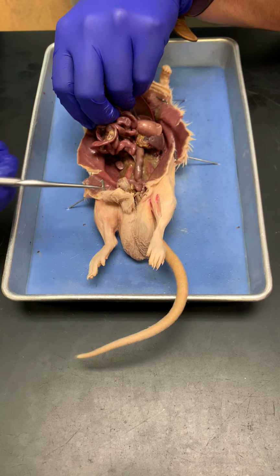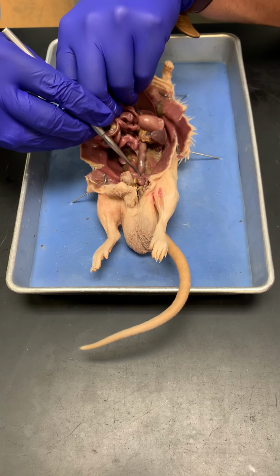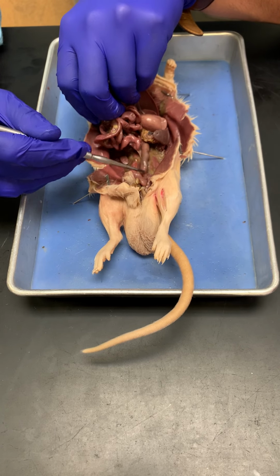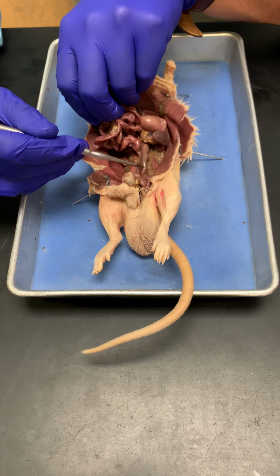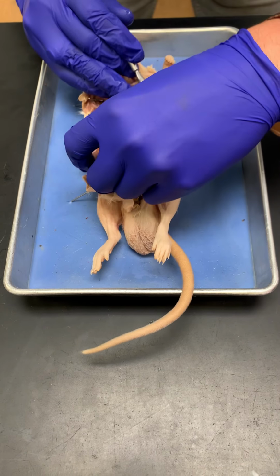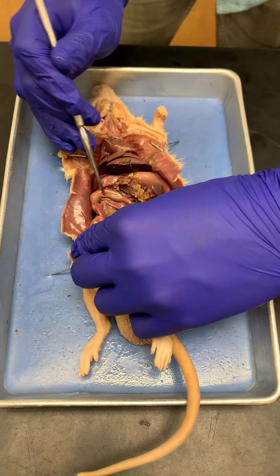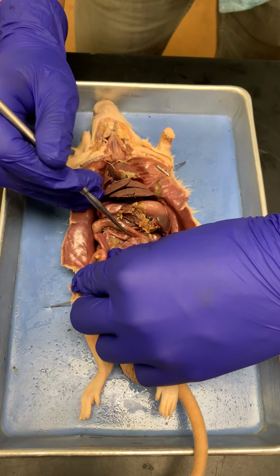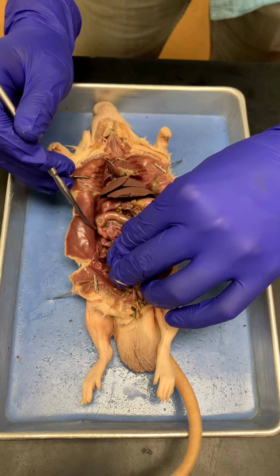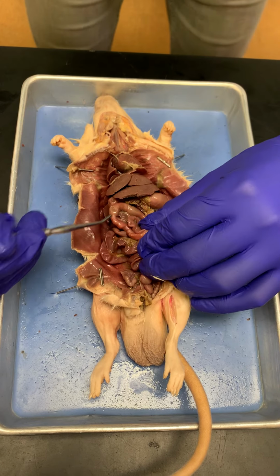We're getting to the poop chute. Okay, so this here is where the rectum is. So the rectum is here, and then this part would be the descending colon, right? So the descending colon is going down to get the poo out. And then if I move it this way, you can see this is the transverse colon, and then this part would be the splenic flexure, because the spleen is right there. And then this part over here, this flexure, would be the hepatic flexure, because this is where the liver is.